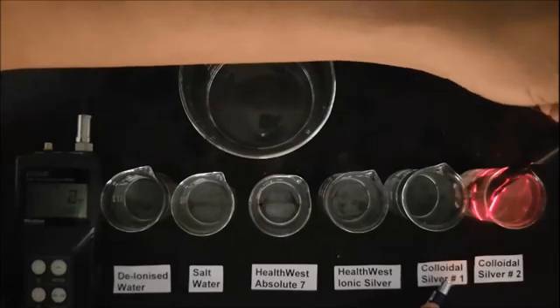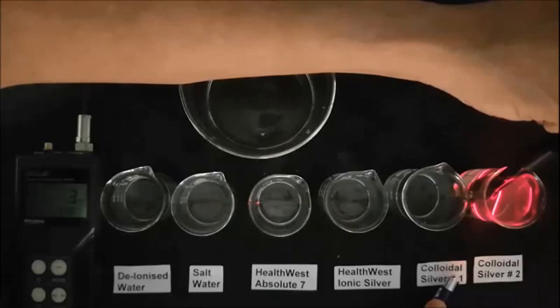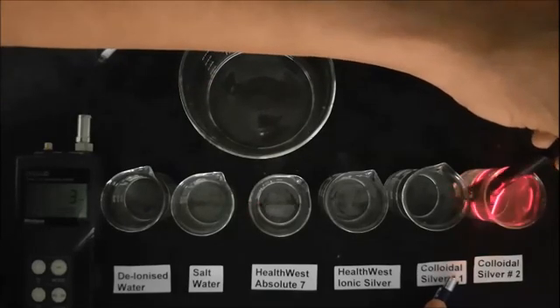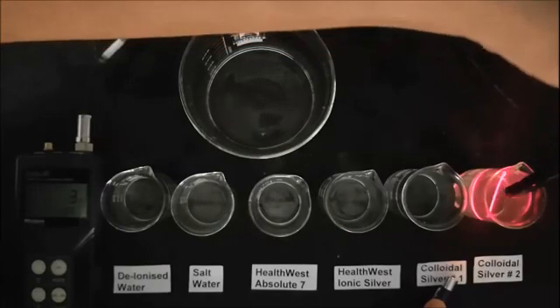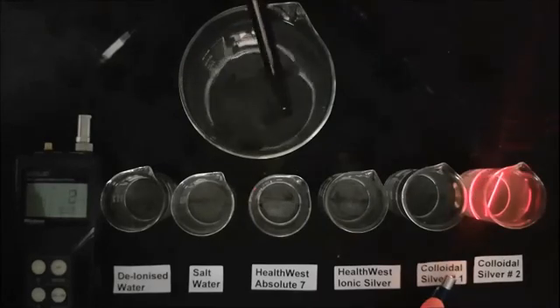The last beaker is a bit of a surprise because although the concentration of colloidal silver is only three parts per million, the laser beam is unusually strong and this indicates a high level of particulate matter or impurities and this brand of colloidal silver should definitely be avoided.